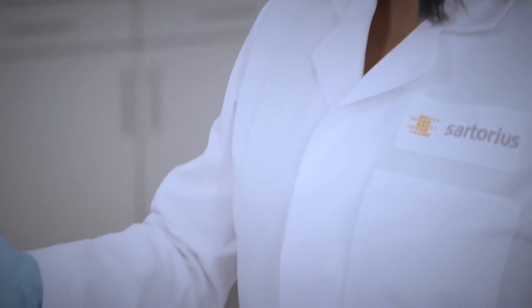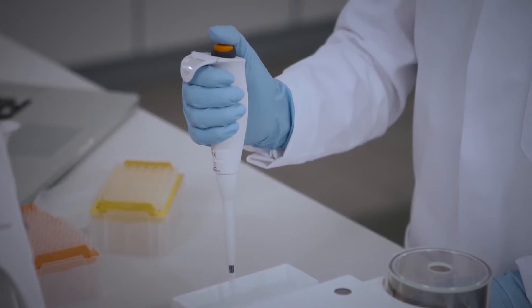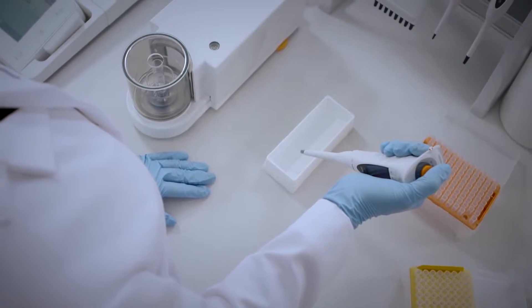When aspirating water, it's important to hold the pipette vertically to draw in the correct amount of liquid. The balance must be tared before calibration. This is often done automatically by the software.